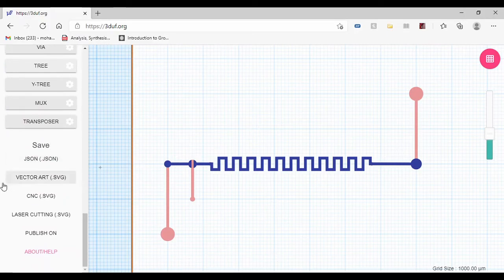So after you finish your design, you go into save, and the best thing I found from trying all of those is that the CNC type is the best one when you want to save your work. I think the laser cutting SVG is not gonna get you the exact measurements that you've designed or that you have in the website, but the CNC file format is gonna give you exact measurements of what you exactly did. So if you used something like 1000 micrometer for the port, you're gonna get it in the CNC exactly as it is. But in the laser cutting file type or in the vector art, it might not be exactly the same.